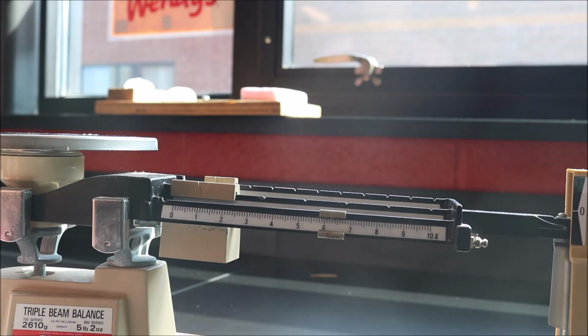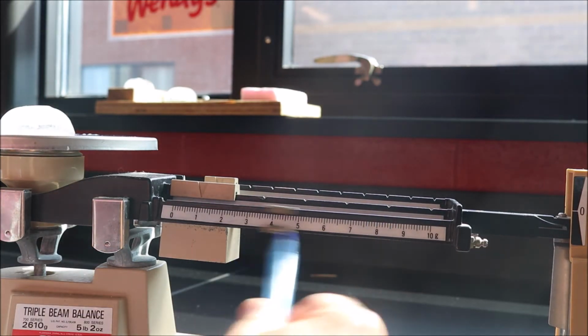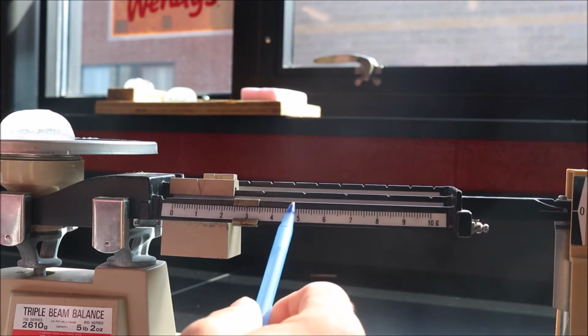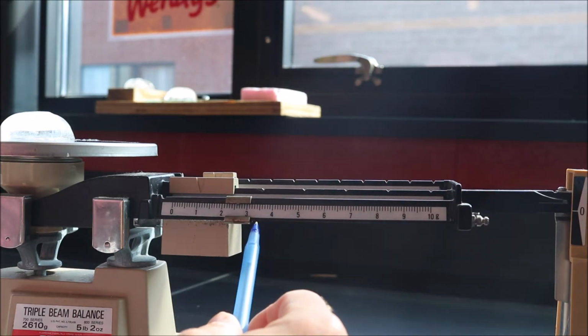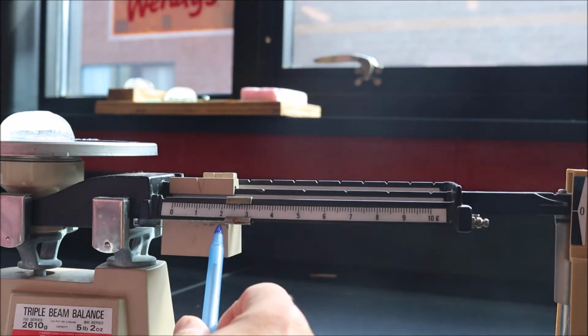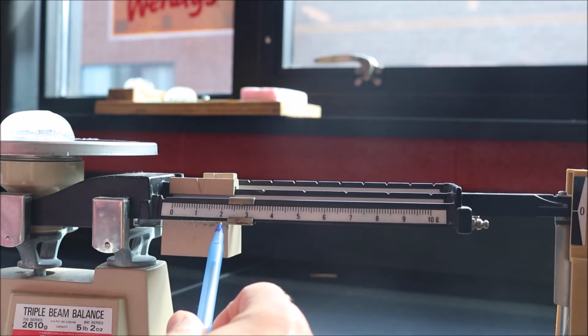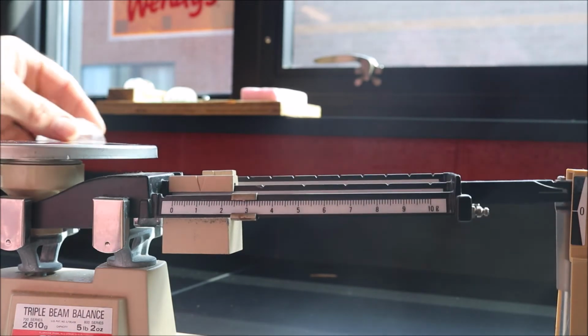Ice cube number 3. One here. They're slippery. All right, it's going to be a little bit less. It's going to be at least 10, 13. No, 12 point something. 12 point maybe 8, 12.9. There we go. We're going to call it 12.9.